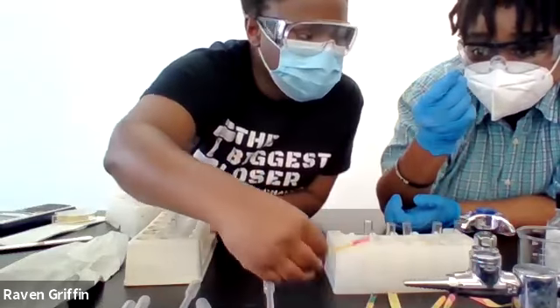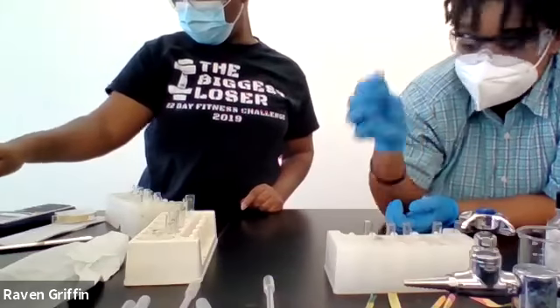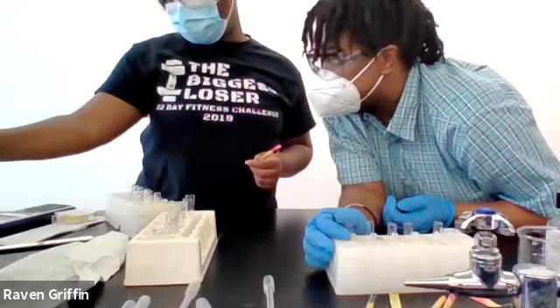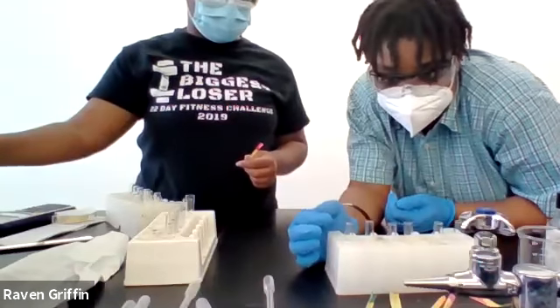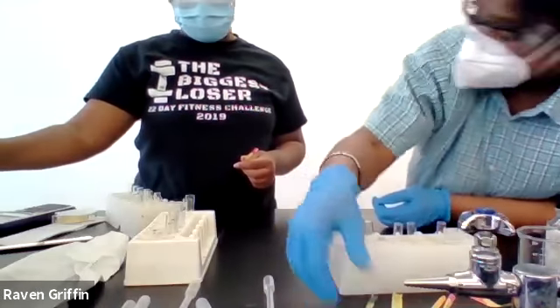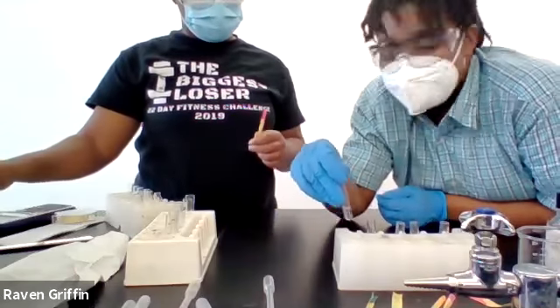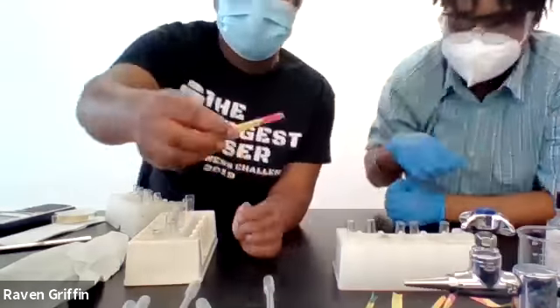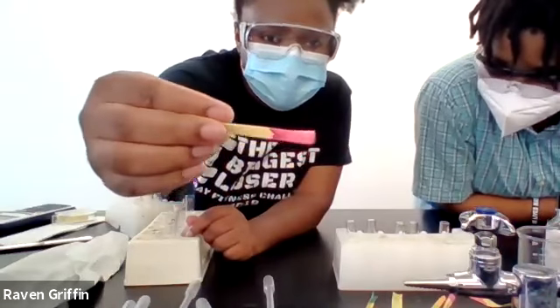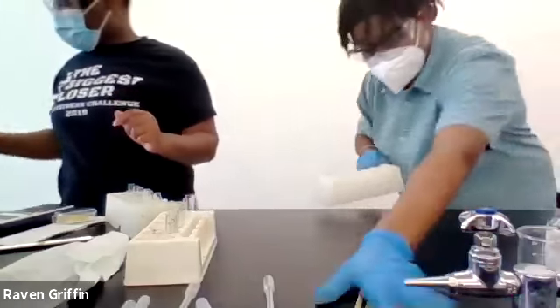What's the last one? I don't even know. Well, that was the end. Yeah, we did initially. So is the last one H3PO4? Yes. And that's this magenta purple color. H3PO4. Okay.